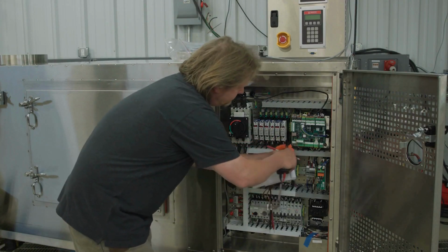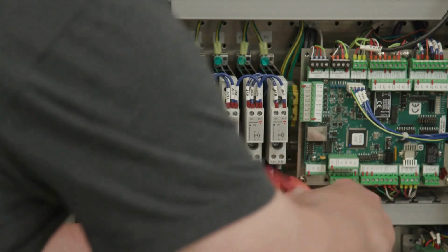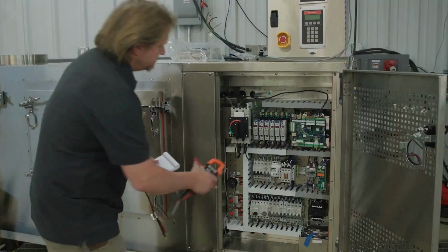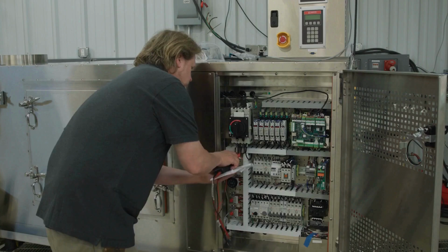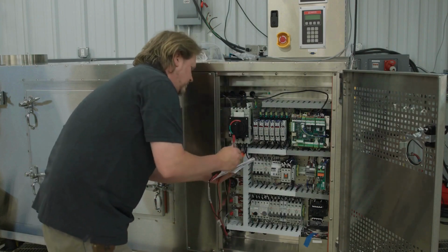Again, using a multimeter, check and record the current. This time the reading should be 0. Line amps number 1. Using a multimeter, check and record the main line current for each phase, if it is a 3-phase power supply.